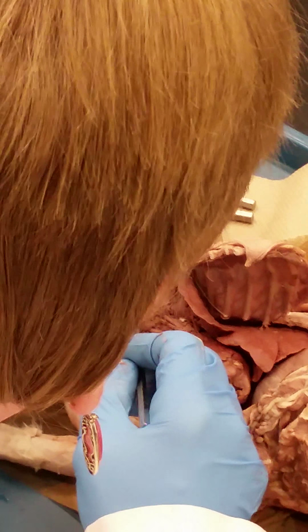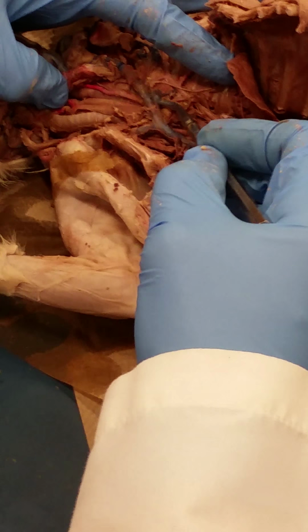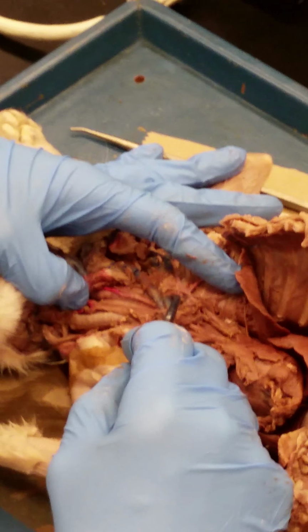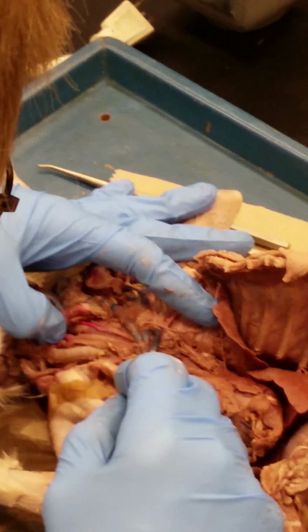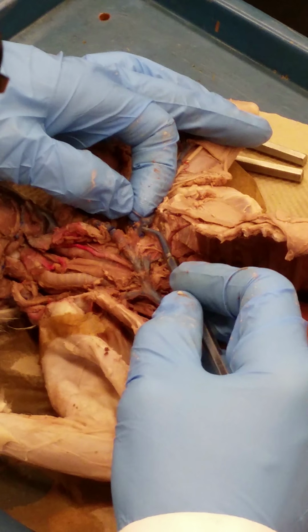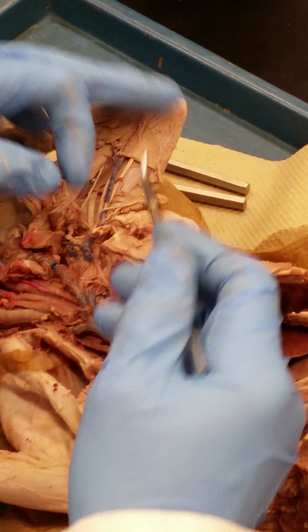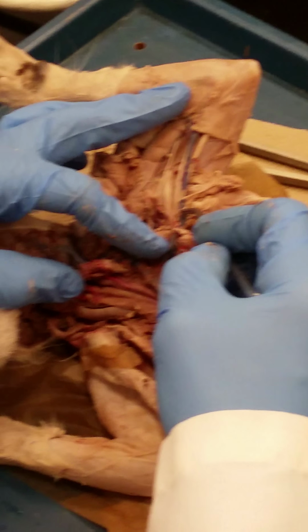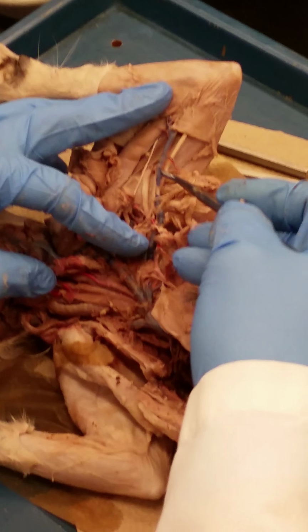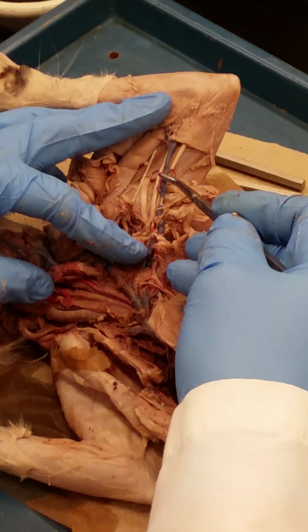The first branch, actually on this kitty, is very nice. You can see this first branch here that's not terribly long before it dives down into the tissues, and that is the common trunk of the costocervical and vertebral trunk vein. And yes, that has shown up on my practicals. The second branch, this kitty does have a break here, would have attached right here, and it would have very briefly been a subclavian vein, which I never asked, but I do expect you to know that once it goes out into the forelimb, this would be your brachial vein running right alongside your brachial artery.